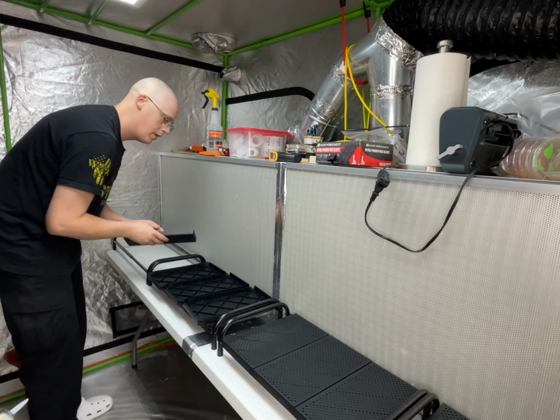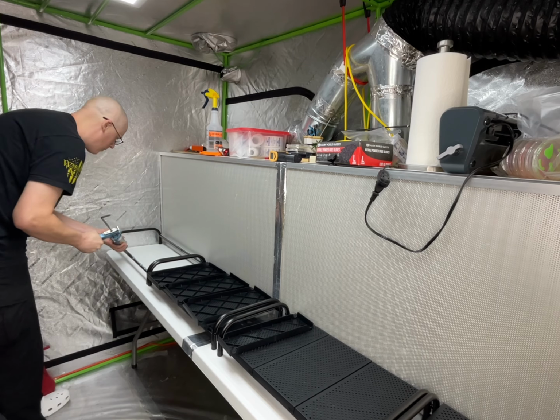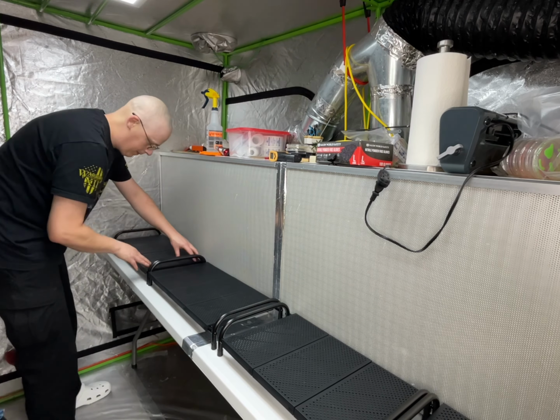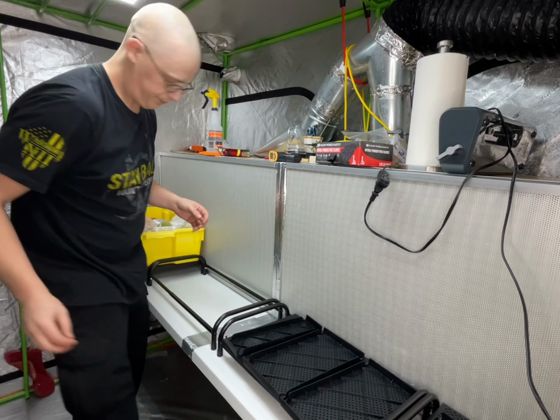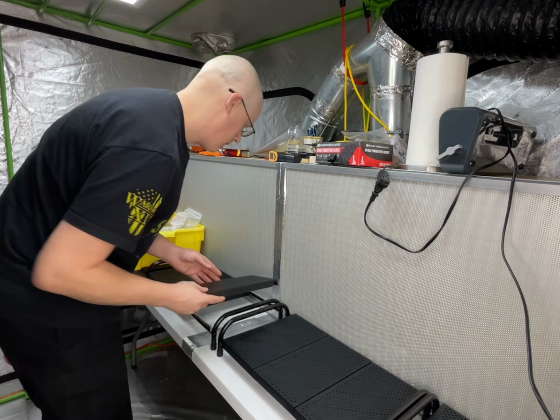Anyhow, here they are in the lab. I got them spread out. They fit. I want to make sure here that my little surface panels don't move around when I'm working, so I laid some clear silicone down on the little telescoping poles that they sit on, and I'm just putting some weight on there in a somewhat level fashion to try and keep it level.